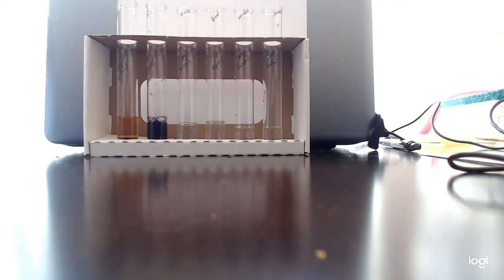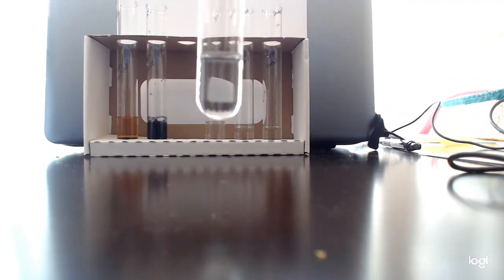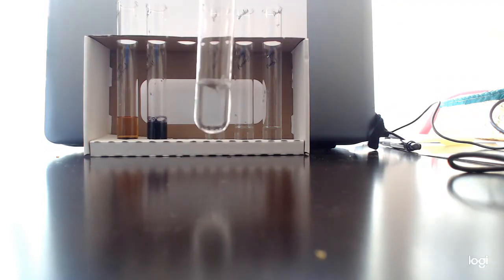Okay. So that's our Biuret test solution. We're going to go ahead now and put our positive and negative controls into that Biuret test solution. So again, our negative control is going to be water, because hopefully, again, water has nothing in it except for water. Now, in reality, the water that comes out of our tap has stuff in it. And it's good stuff most of the time. Stuff that's been put in by the city in order to keep the water clean for all of us. But it should not have any protein.